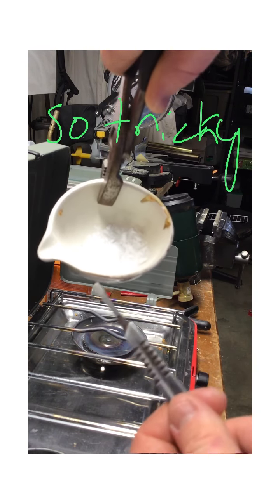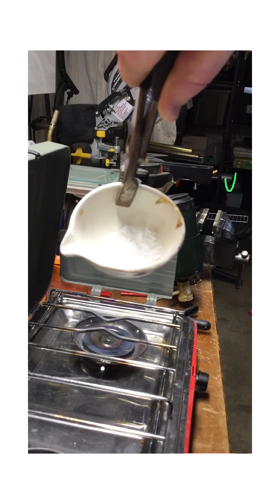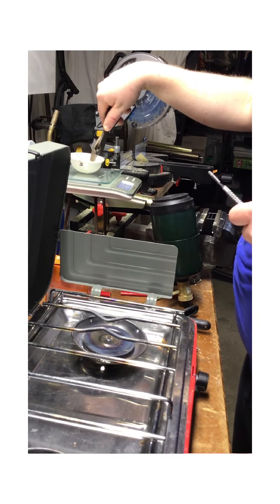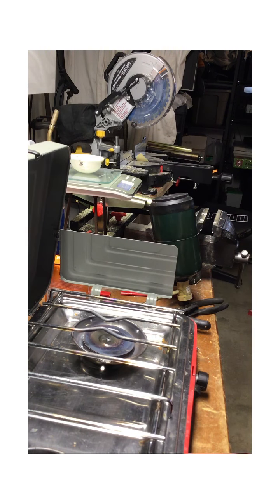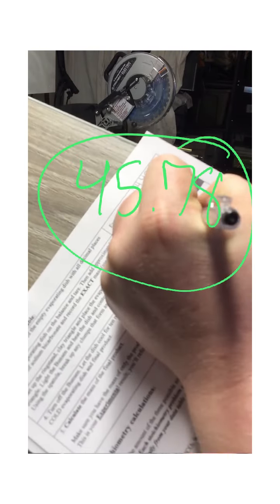Now normally you wouldn't want to put anything hot on a scale because that's going to warp it and totally damage it, but my scale happens to have a glass top where I can put something hot on it. It's cooled down most of the way. So I'm going to take this and put it now on the scale. And I have the reading of 45.780. So I'm going to record on the data table 45.78, okay?